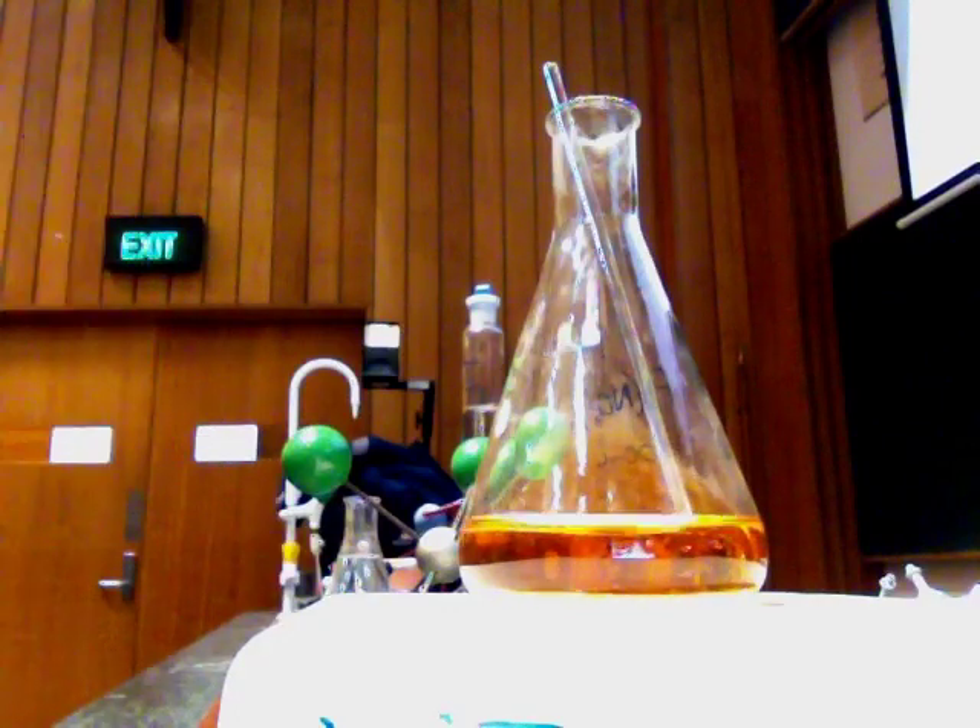The first thing I'm going to do is add some HCl. HCl solution — HCl is a strong acid. The HCl solution is completely split up into H+ (H3O+) and chloride. There are no HCl molecules in here. The major species present is water, H3O+, and Cl minus. So this is a source of Cl minus.